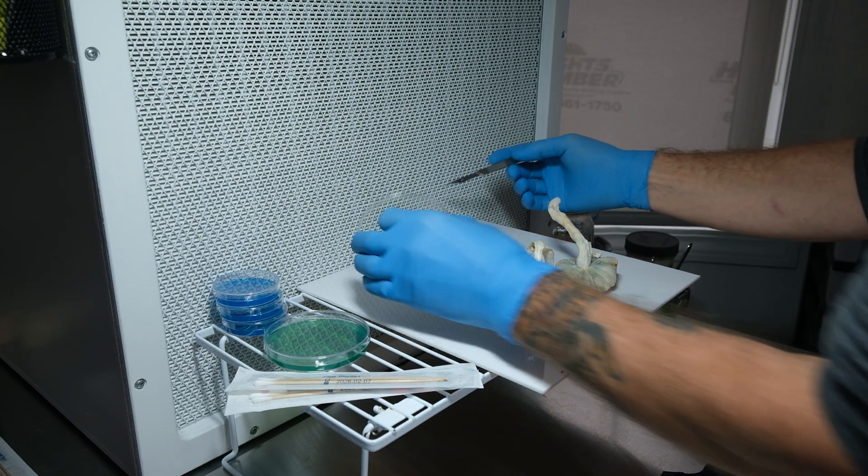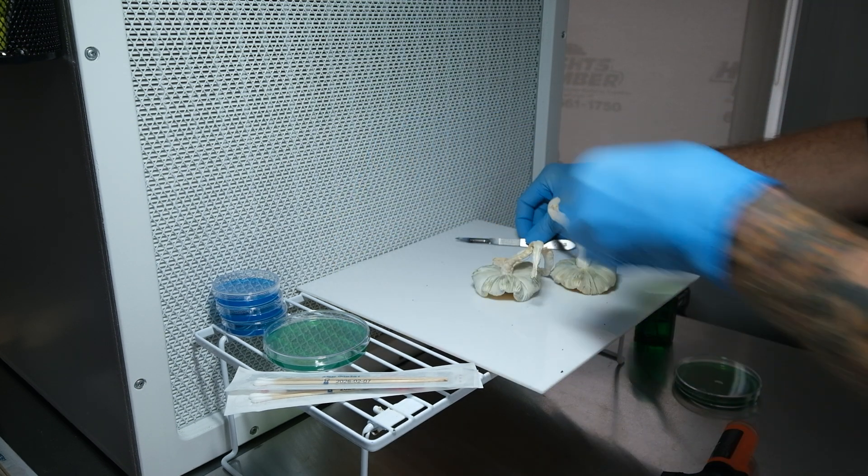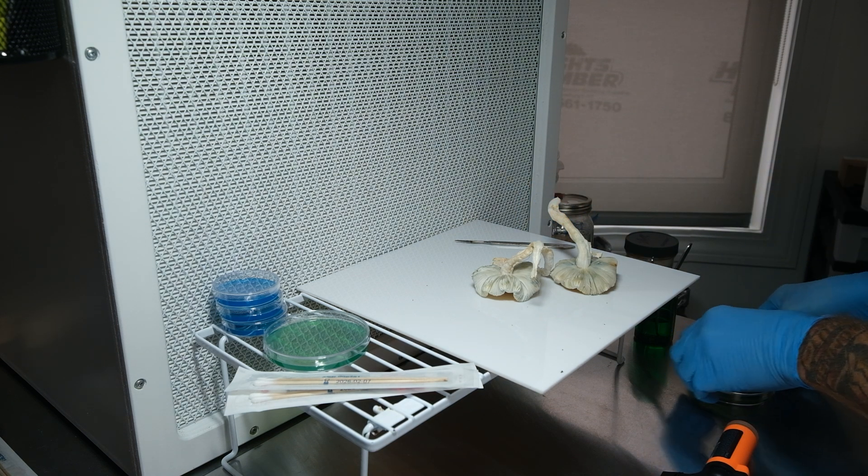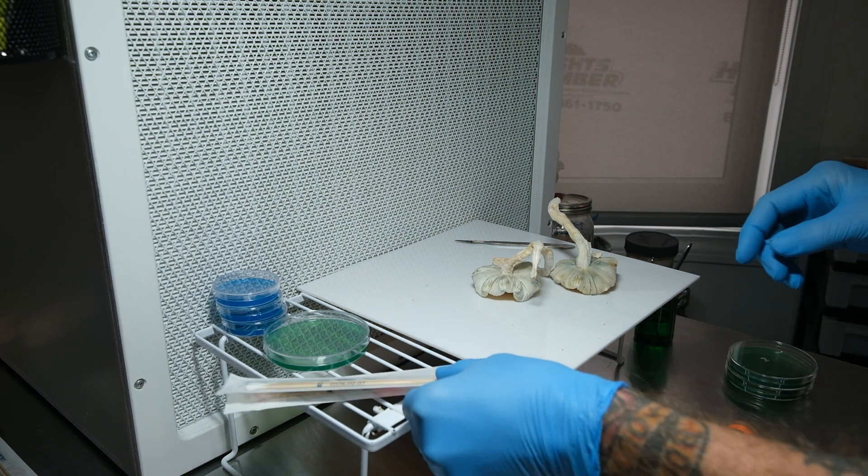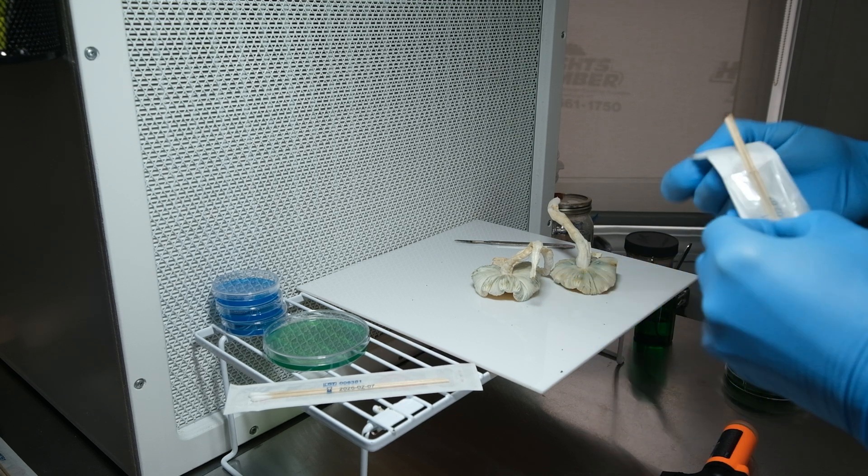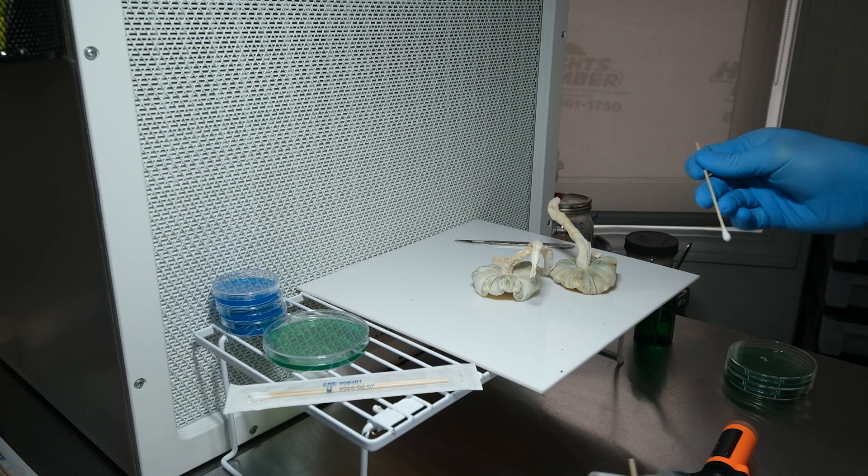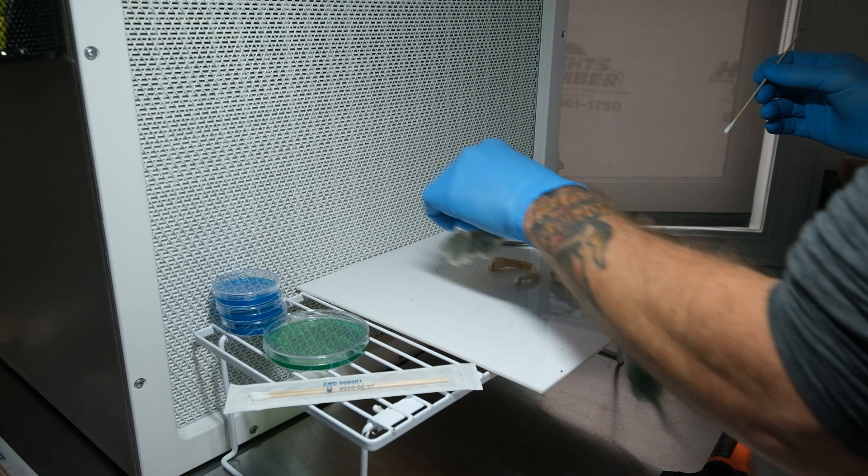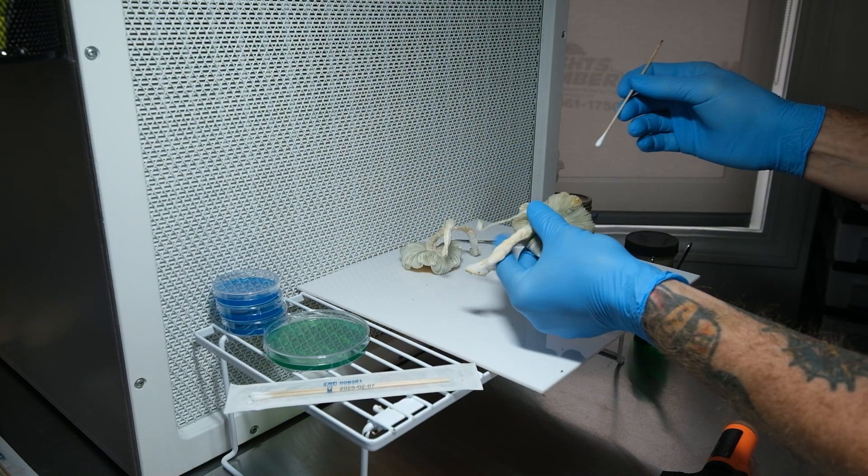All right, now without hovering we're just going to drop it in there. Put that away and label it. Okay, next. And this is really what I'm about right now because I already cloned those last night.